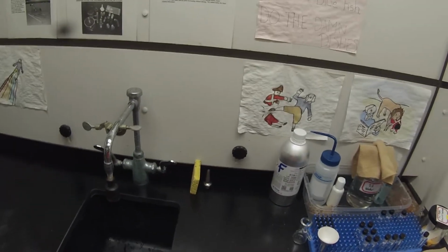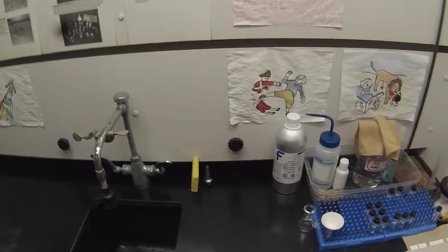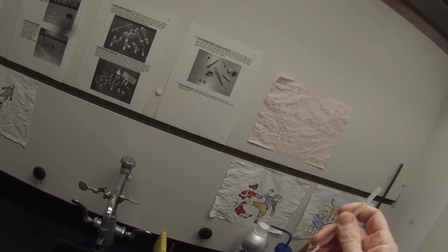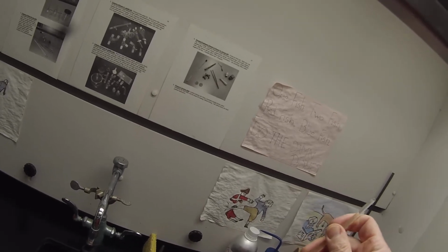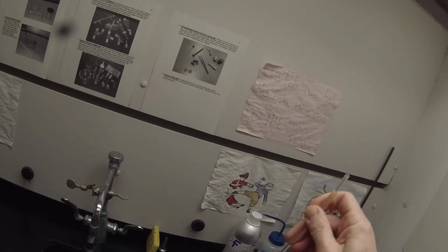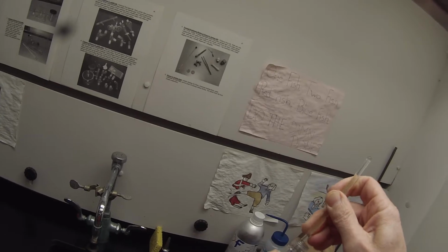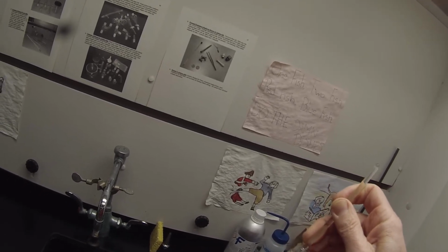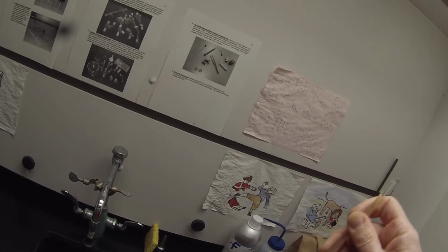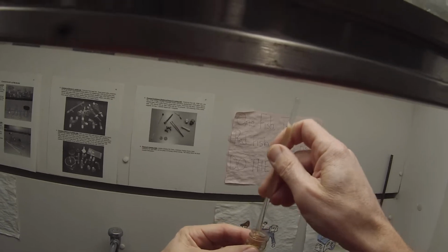So I'm gonna uncap that. And I'll start by just scratching again, just in case. You know, now that it's all the way at freezer temperature, it decides it will condescend to come out. And it won't.